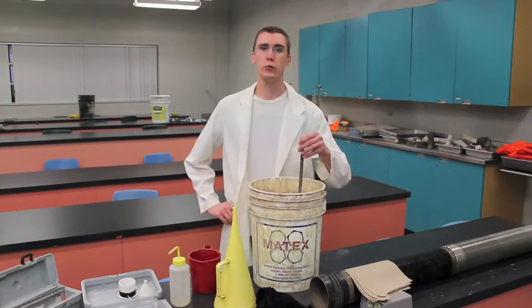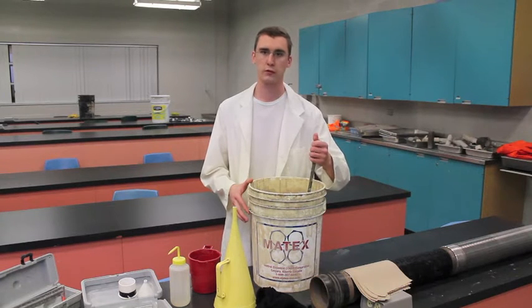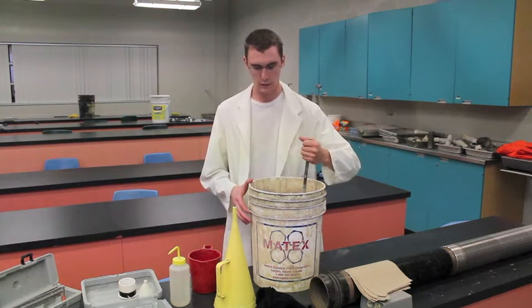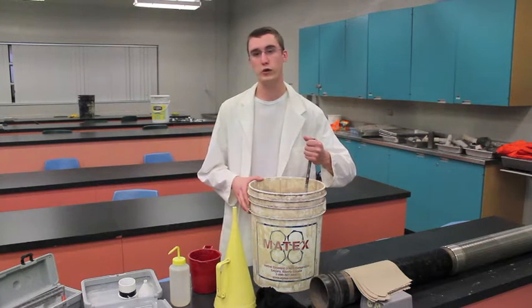So the first thing you're going to want to do in the field and the first thing that we're going to do in the lab is we're actually going to mix up our mud and just get it moving, and this will just give us a better representative sample when doing the test.